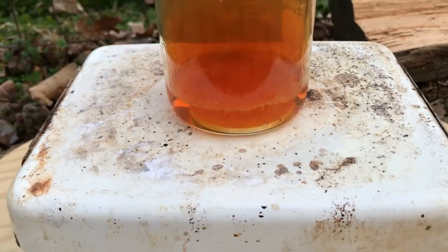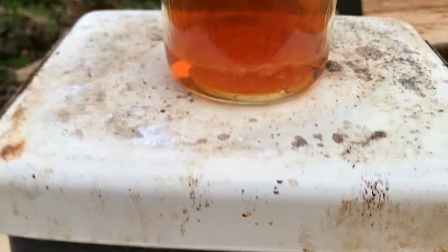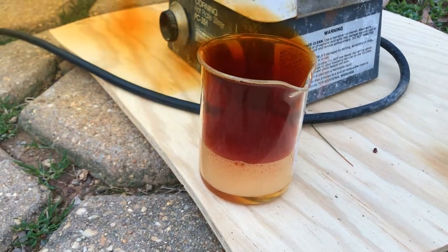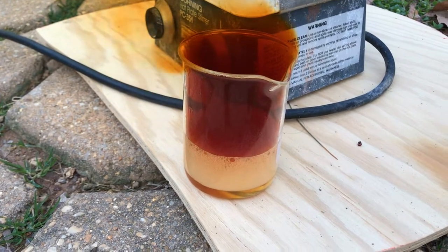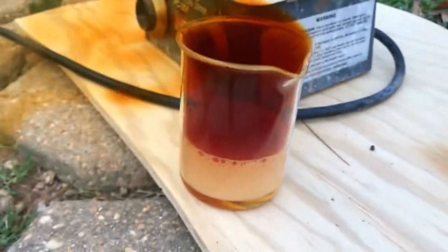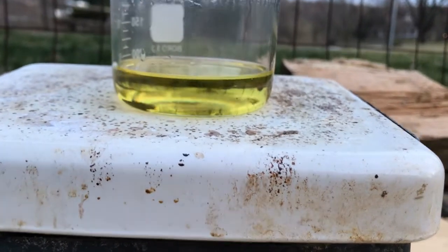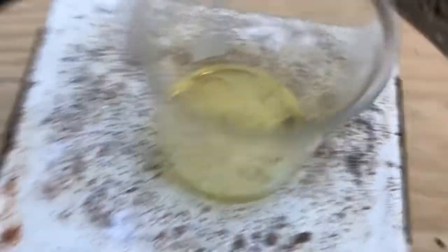As I turn on the heat, the silver coin starts to react, but it doesn't react to the degree I'd like it to. So I add some water, and that destroys the passivation layer, which allows the formation of silver nitrate rapidly. At that point, I let it react until there's no coin left, and I'm left with this yellow solution, which should be pure silver nitrate.